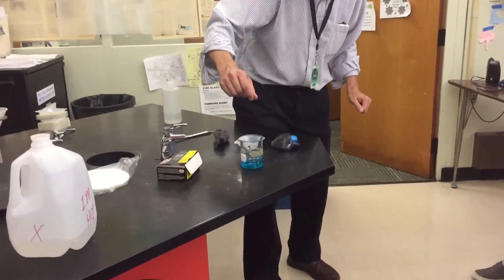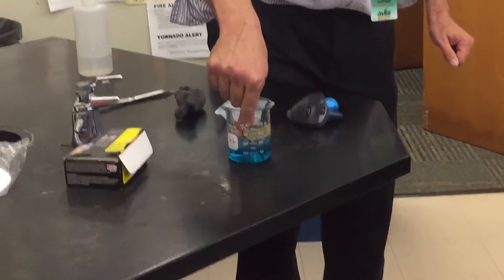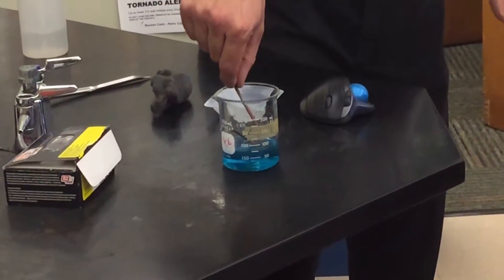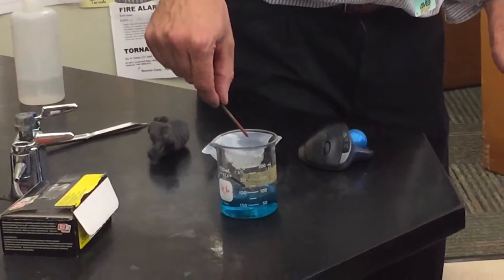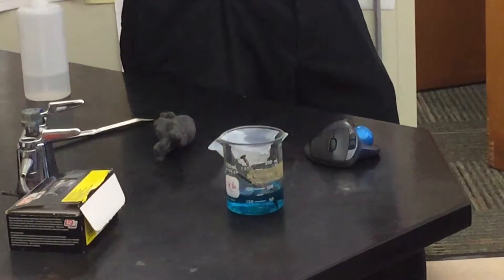Okay, immediately, you start seeing some stuff forming. What do you think is the stuff that's forming there? Rust. Rust. Okay, now, rust would be a great thing, but rust is iron plus oxygen.